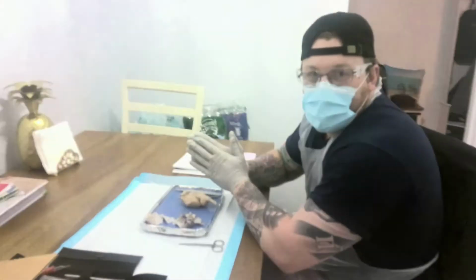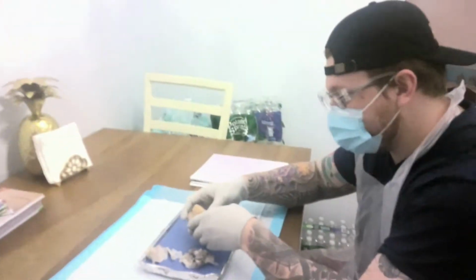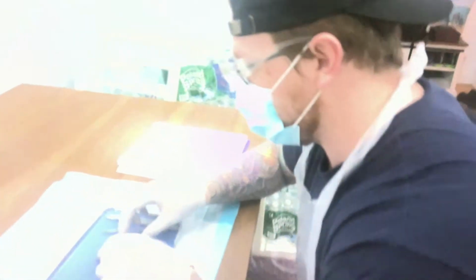Name is Jacob Berry. We're about to get into the sheep's brain dissection here. So let's start it off. As you can see, there's no diagrams or anything. I just have my structure list.